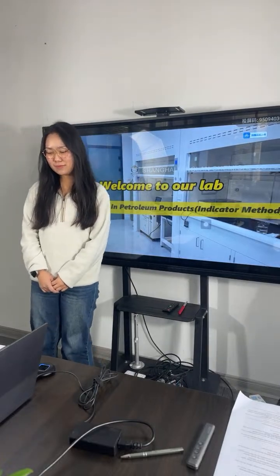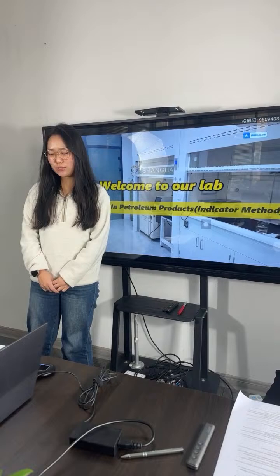Today we will show you a video about the TBN value test. Here's my partner Winnie. Hello everyone, my name is Winnie. In this video, we use the indicator method to test the base number. Hannah, do you know what base number means? Yes, base number means the amount of perchloric acid required to titrate 1 gram of sample with standard titration solution.